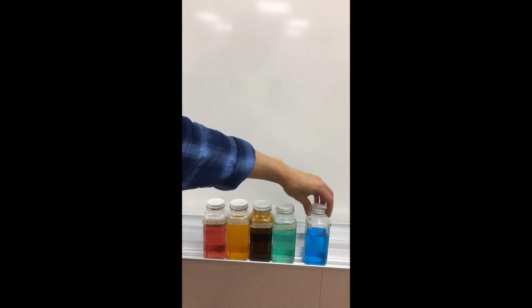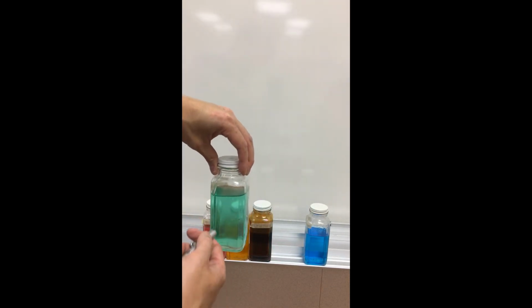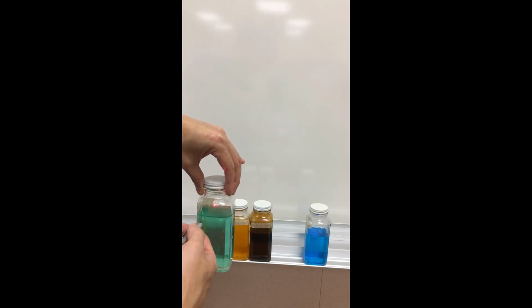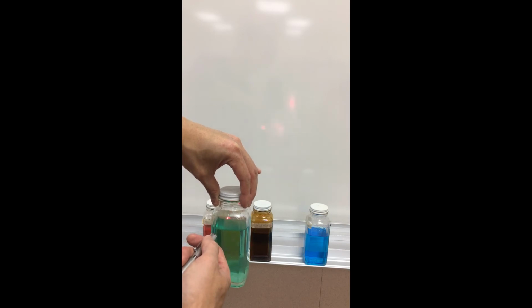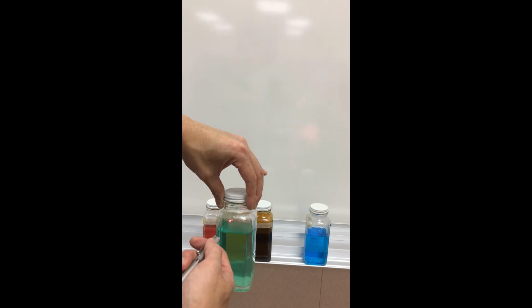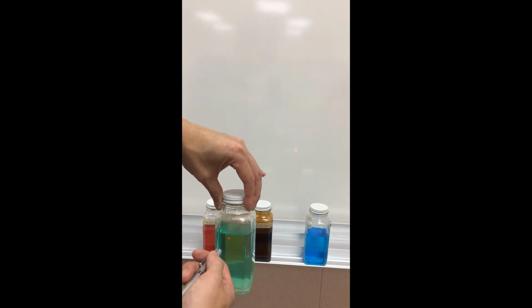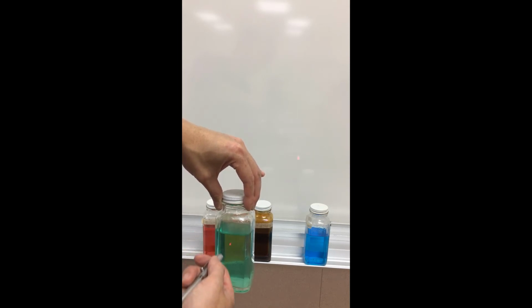Okay. Let's compare it against a few other transition metal ion solutions. So green is also across from a red wavelength as well. We're going to see whether this gets absorbed. You have to look at exactly what wavelength this red is sending in. So it's getting through the glass, no problem. As I go through the green, it is getting through ever so slightly here. We're going to find that depending on the concentration of the solution, that can also have an impact on how much red is actually absorbed.